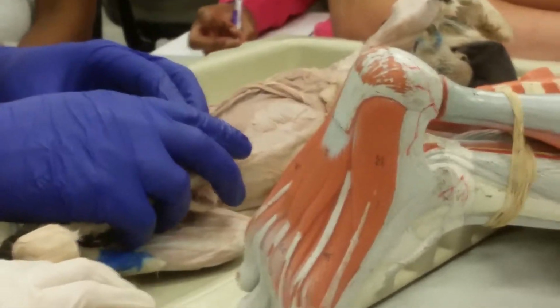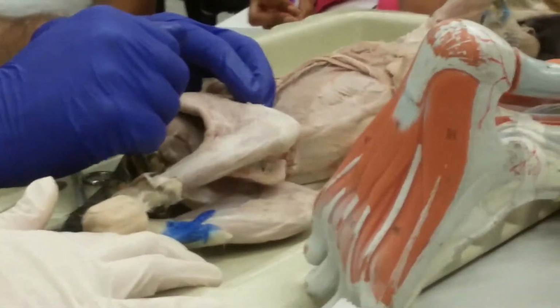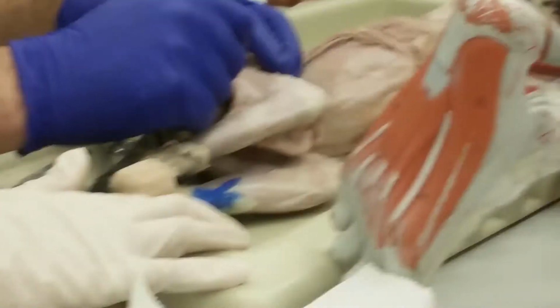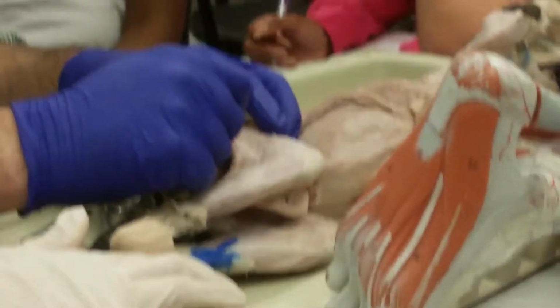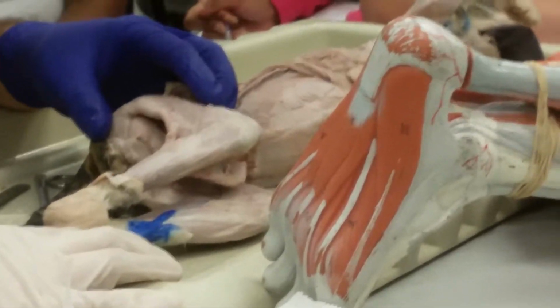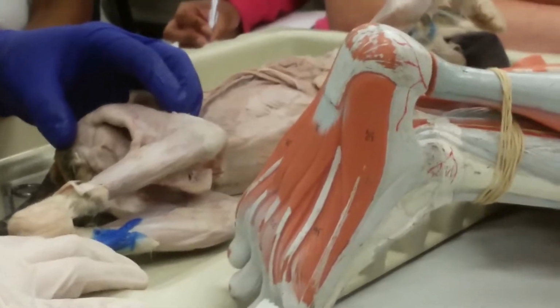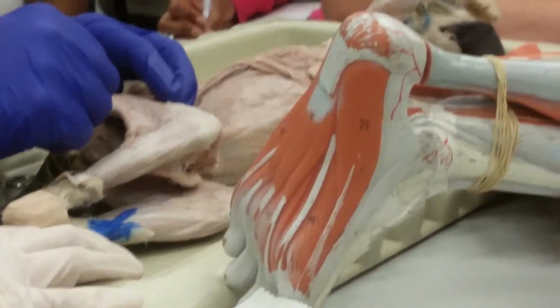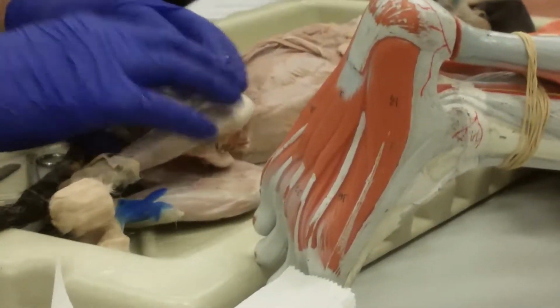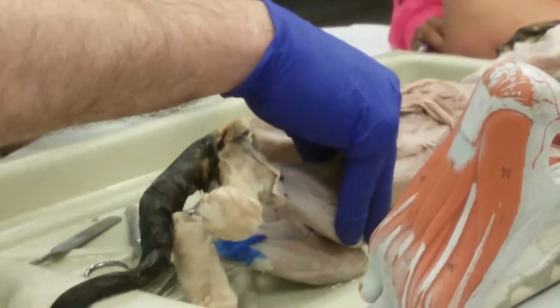Extend and hyperextend. Now, what's not on there is the gluteus maximus muscle, which goes from the pelvis down to the greater trochanter of the femur. I think it's greater trochanter, I have to double check that. It pulls from behind the femur, and it's the major extender and hyperextender of the femur. It's a very important muscle in humans, one of our major postural muscles. Cats are not upright, so their gluteus maximus is up here, and there's some fascia somewhere. I'm not going to worry about it.